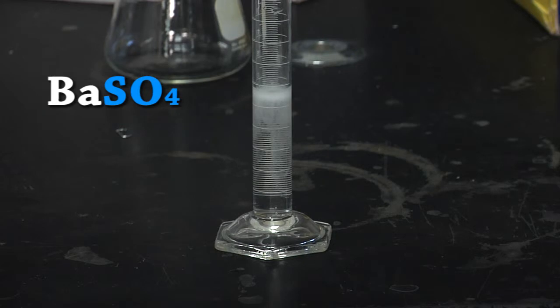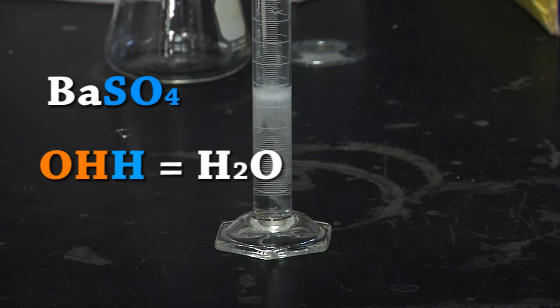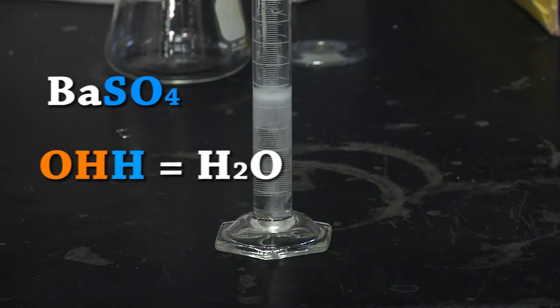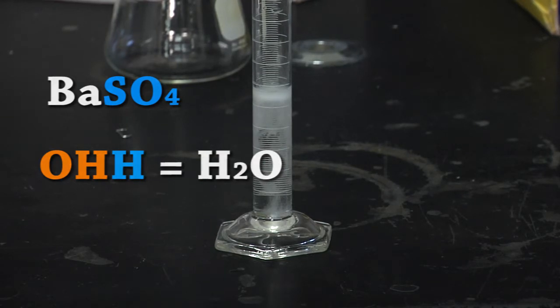And finally, we will have to adjust our pH to as close to seven as possible using sodium hydroxide and sulfuric acid. Make sure to use highly dilute solutions as to avoid overcompensating for pH.